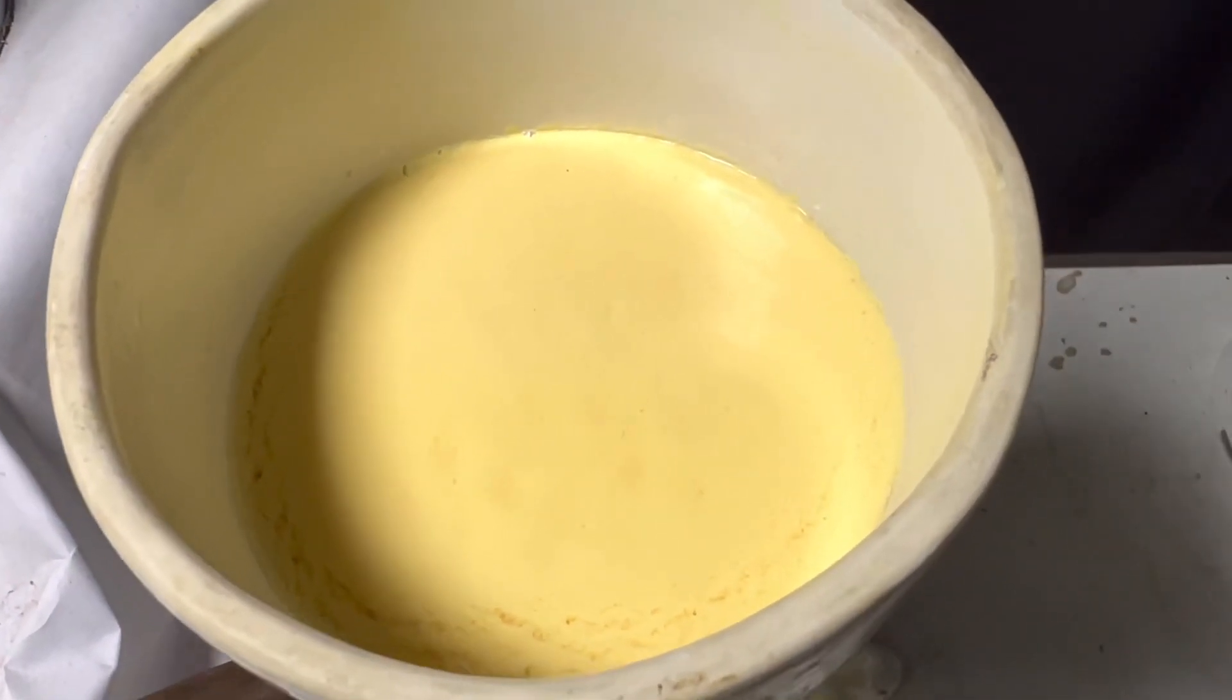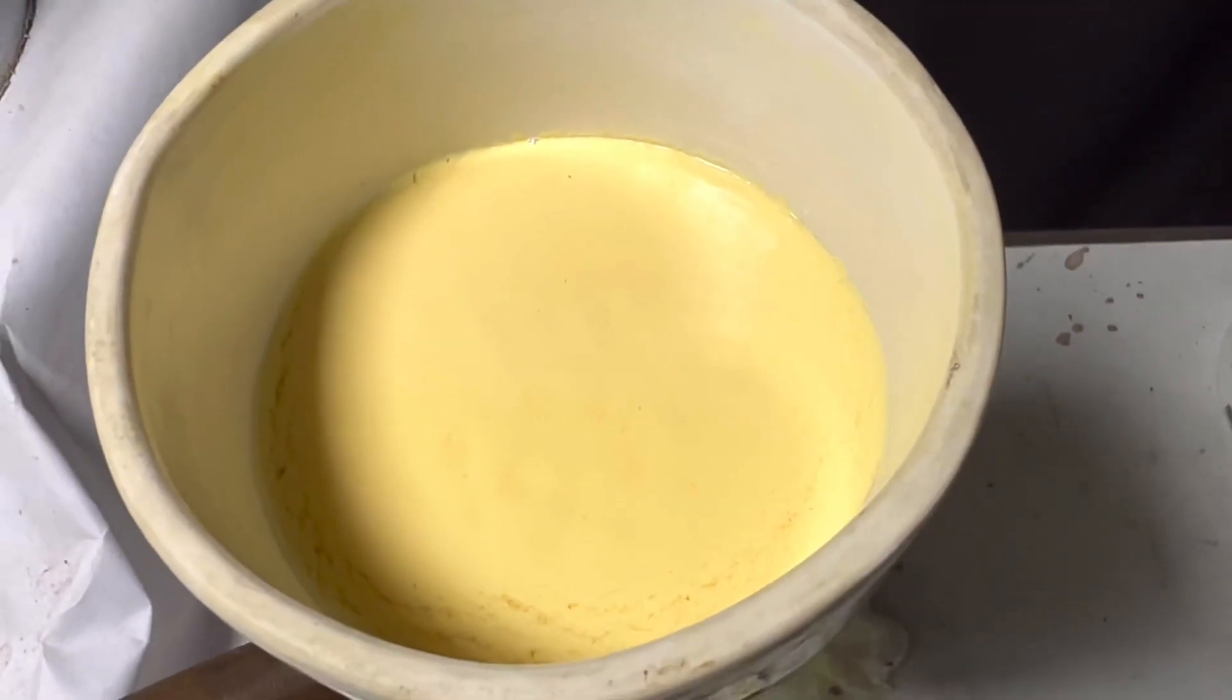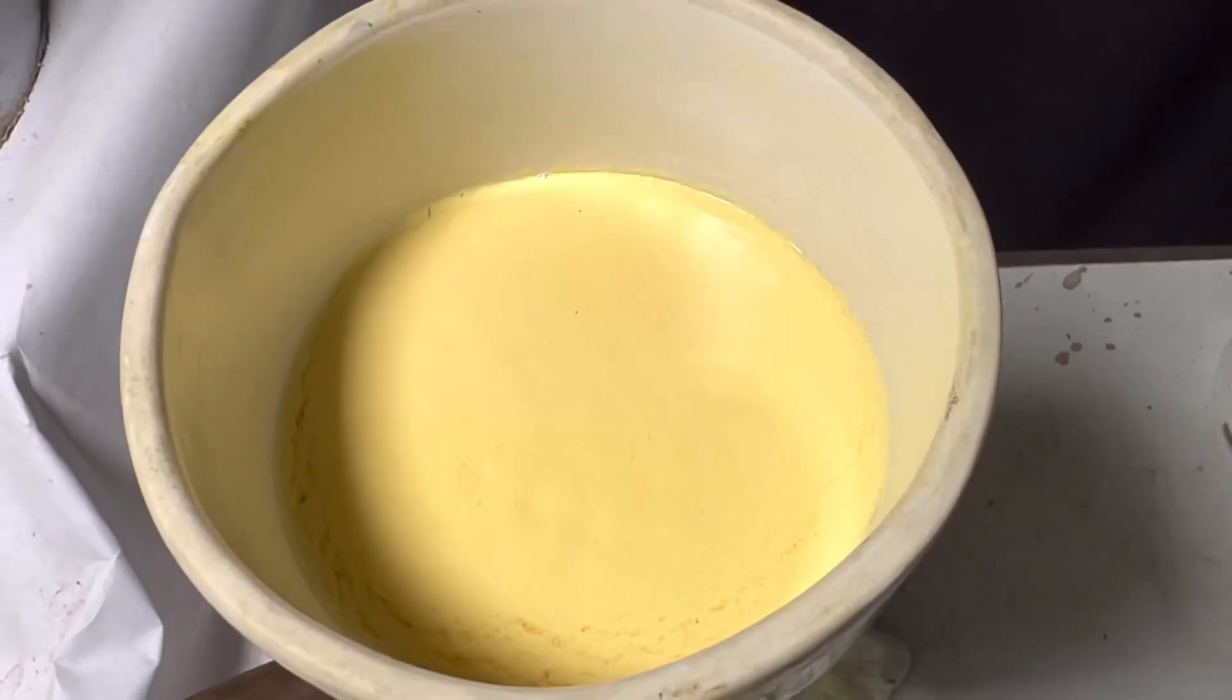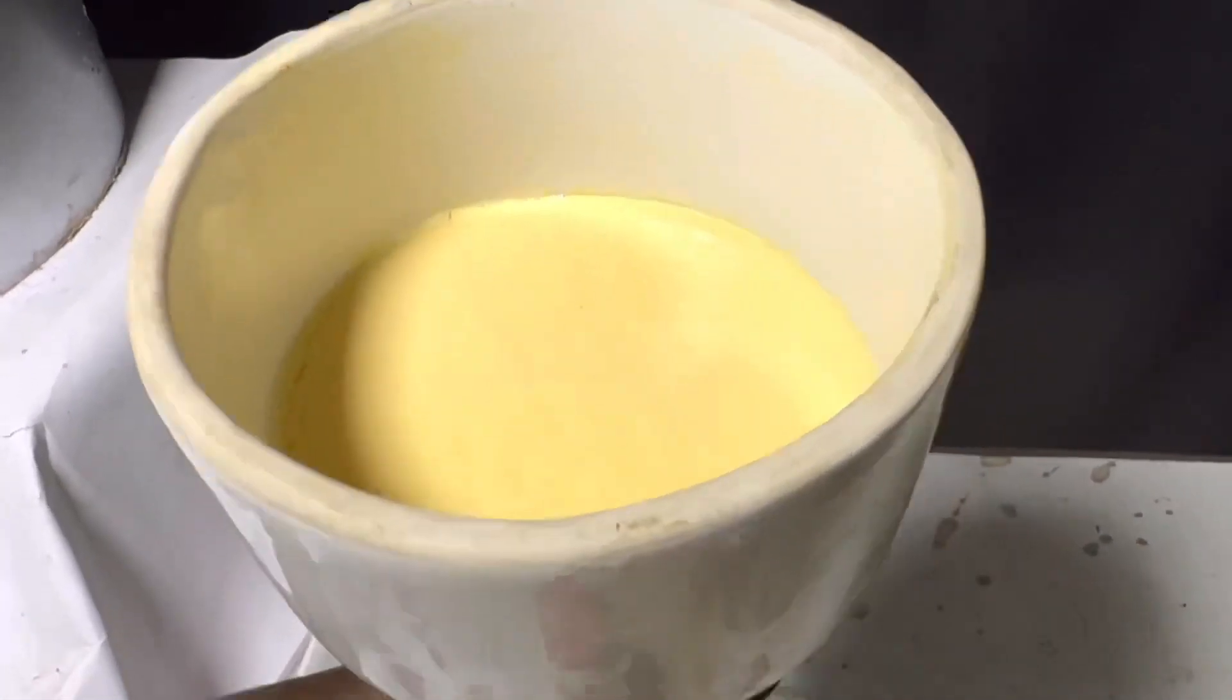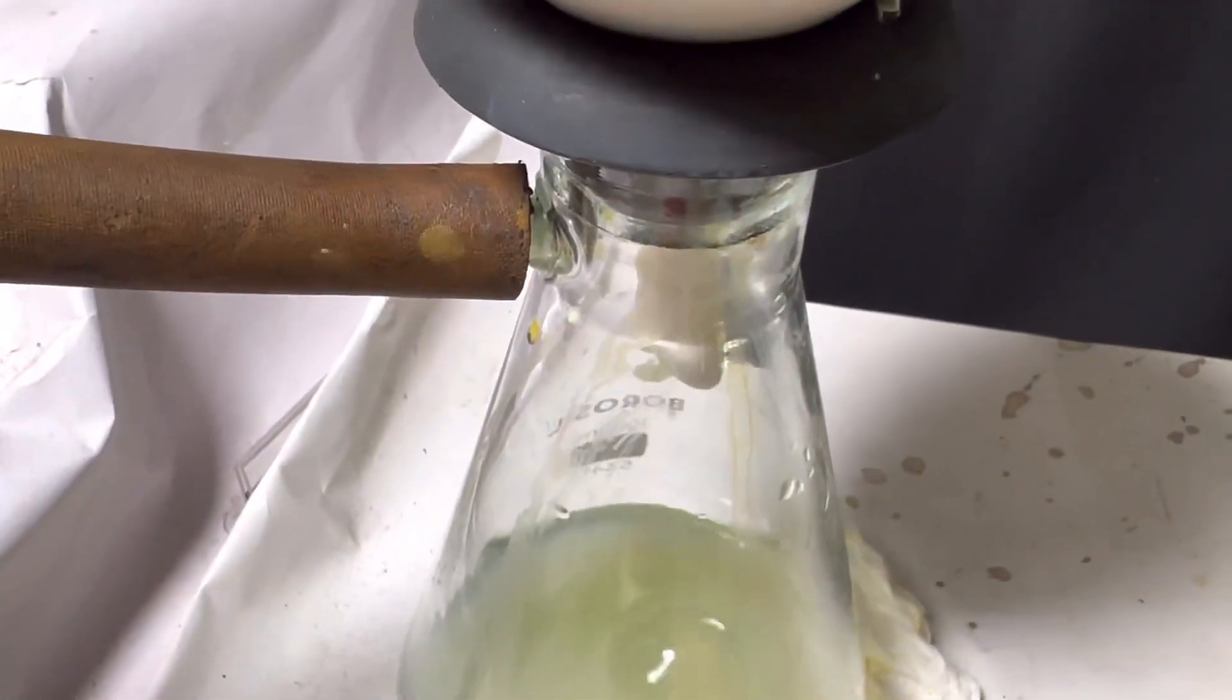Finally the precipitate was collected using a Buechner funnel. The particles are very fine and easily clogs the filtration system causing a lot of time for filtration to complete. So be patient.